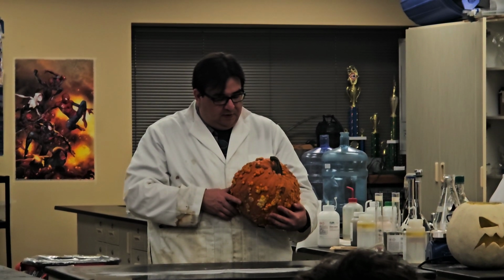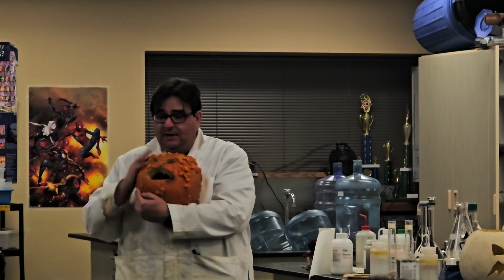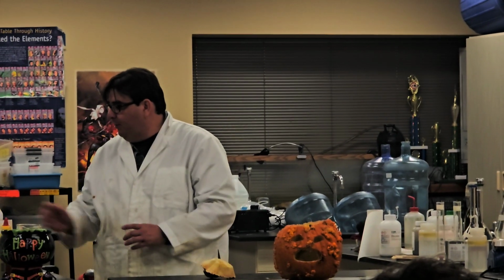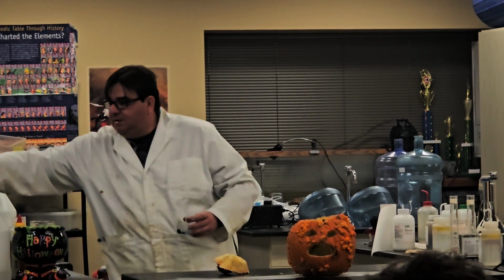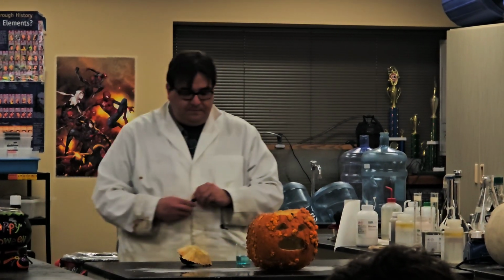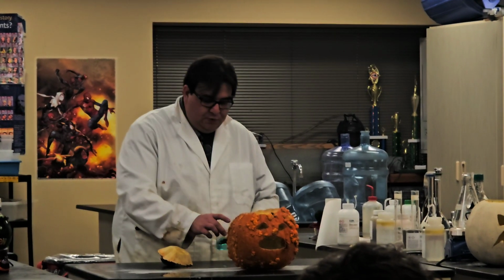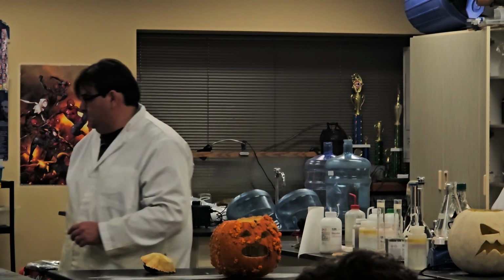One of the things that I get to do during Halloween, since you all give your souls in the green fire today, is we're gonna help this little buddy. He's sick of a pumpkin. I mean, he's not feeling very well. So we're going to help him by putting in some mixture, and we are going to use the old way of curing people, which is to induce vomiting. Try to make his vomit green, for science.